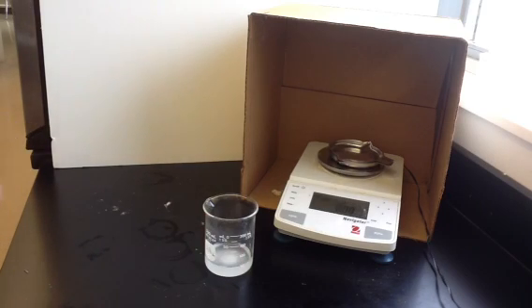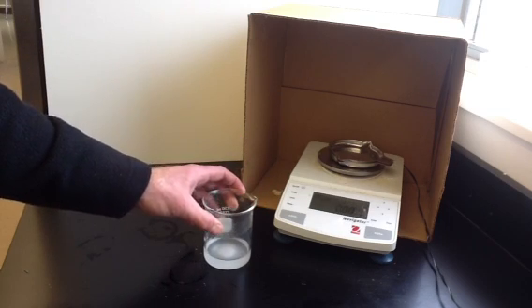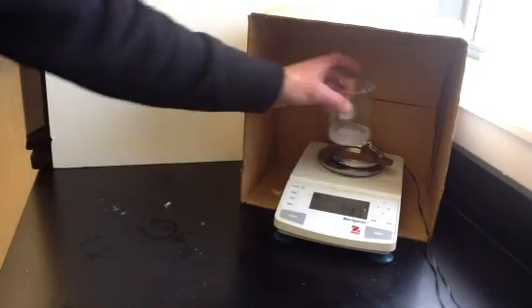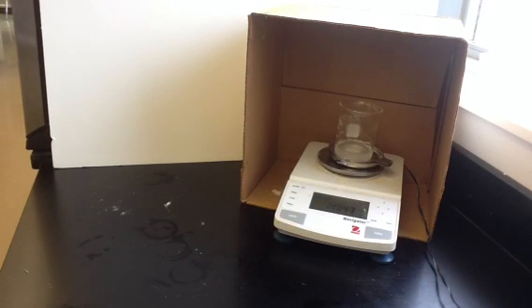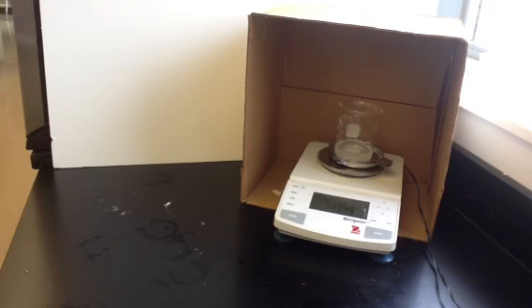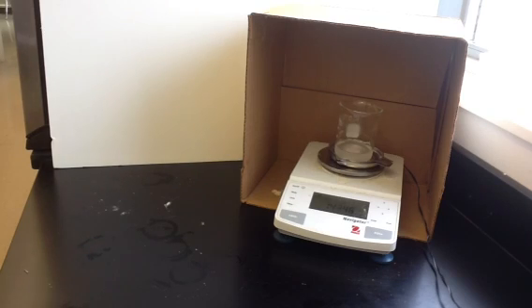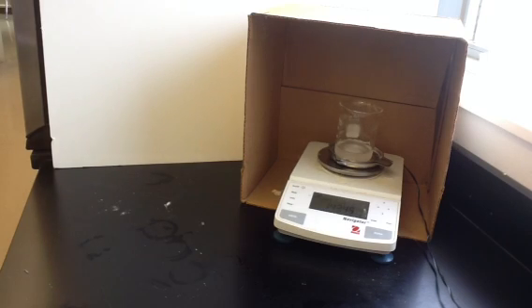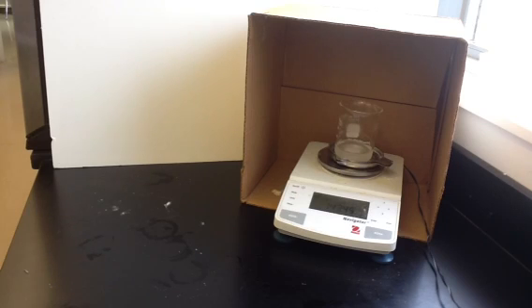We know from the law of conservation of matter that the products have to have the same mass as the reactants. But this beaker will weigh less than the sum of our two reactants, because a lot of the product has been released as carbon dioxide into the room. We put this on the balance and find that it's 143.47 grams — that's the mass of the beaker and the products remaining after the reaction. By taking the difference, we can figure out how much carbon dioxide was released, then use stoichiometry to determine how much sodium bicarbonate was used and what percentage of the mixture it represented.